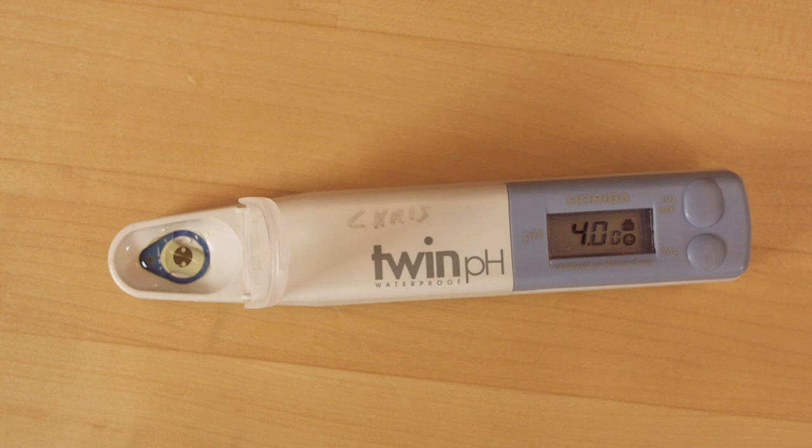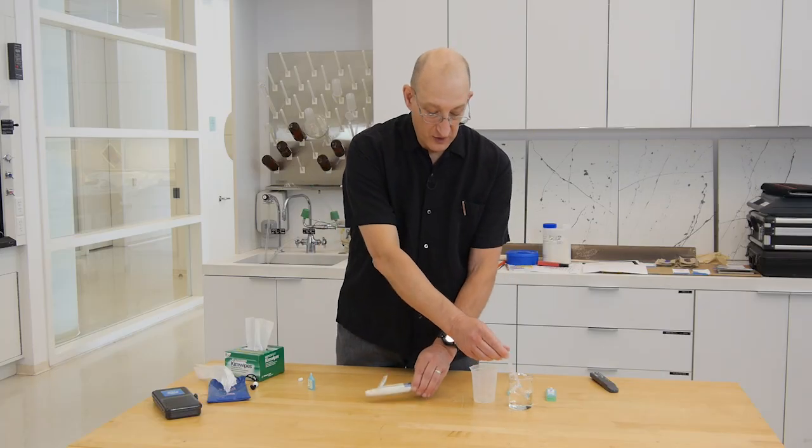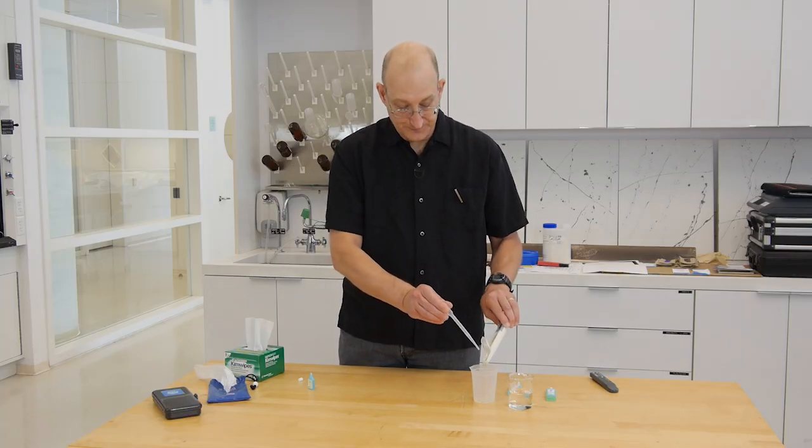We now have our happy face, and again, we just rinse with deionized water, and we're all calibrated. That's it.